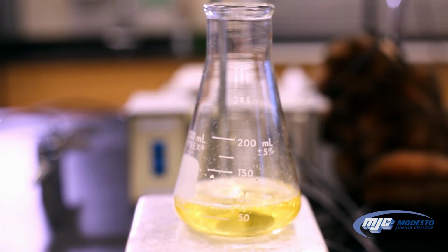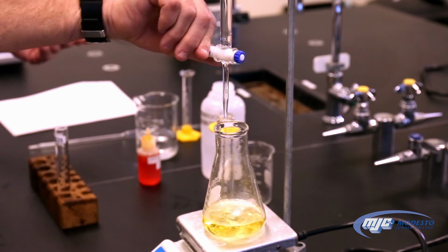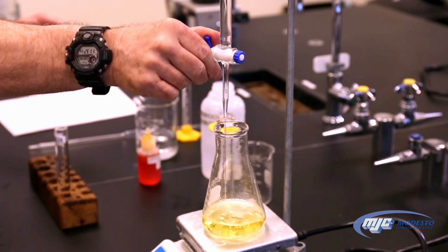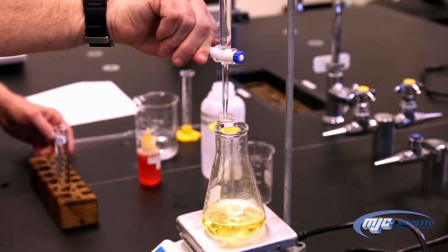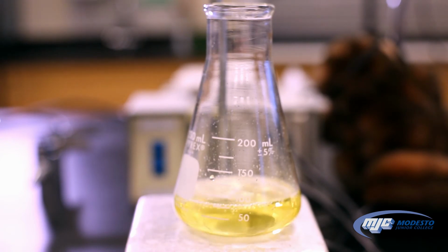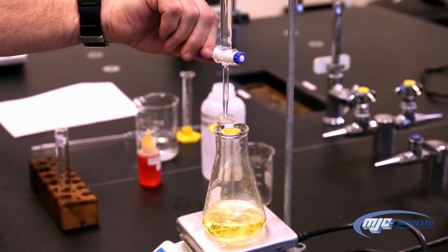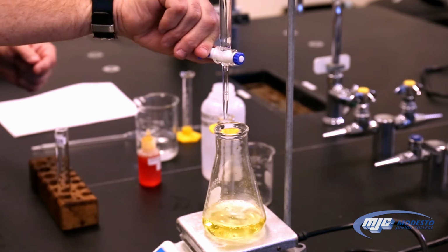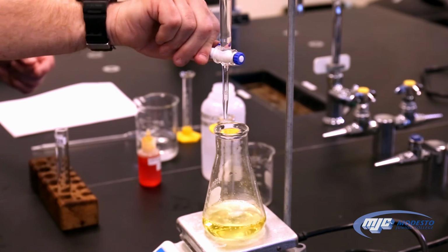There, a little bit of color. I don't know if you guys can see that, but there is a little bit of green in there. So I'm going to go a little bit slower, which means I'm going to twist it a little bit faster. I don't know if you can see that. There's a splash of green that's coming in there. And it's starting to last a little bit longer, which means I'm going to go slower, which means twist the stopcock faster.